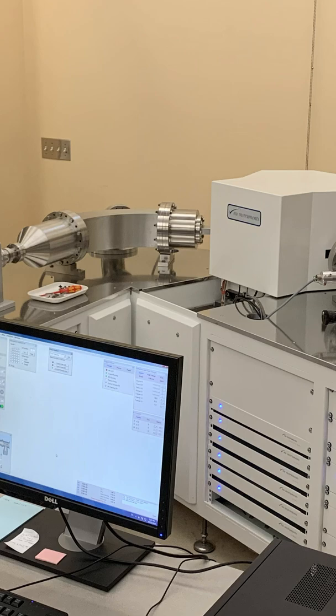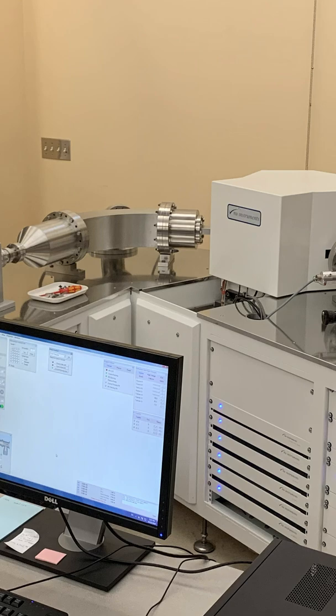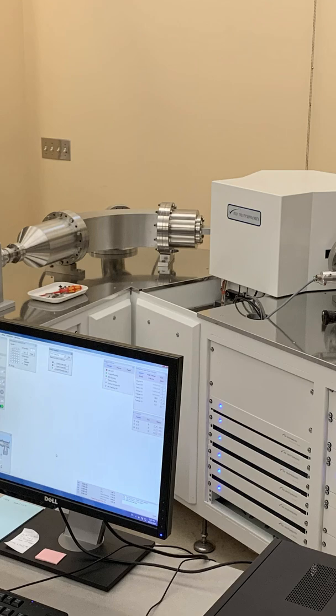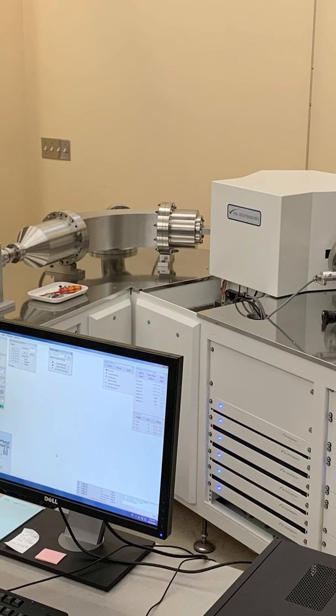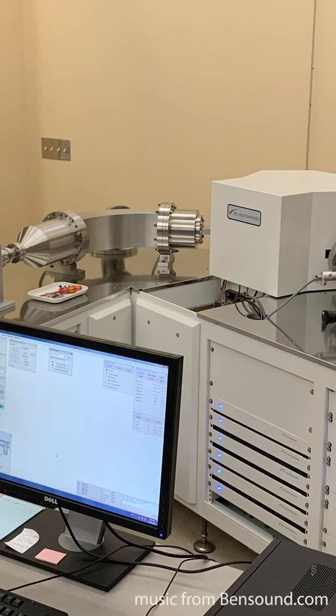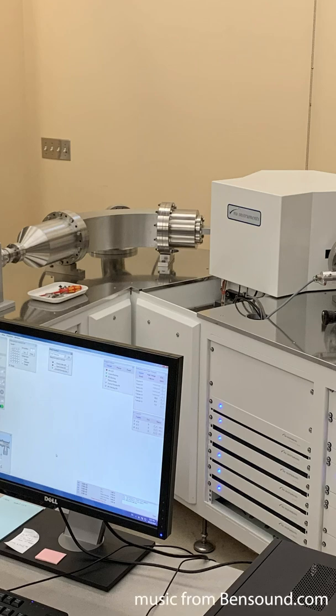Once we've purified our sample, we're ready to run it on what's called a mass spectrometer. The mass spectrometer allows us to measure individual elements down to parts per trillion levels — for every trillion atoms we pass through it, we only need one or two of the element we're interested in to be able to measure it. So we go from a really hard solid rock into a solution, into something purified sometimes to just a single element, and then we're able to accurately measure that down to the parts per trillion level. Geochemistry is incredibly powerful to tell us a lot more about the Earth as it is now, as it was in the past, and how we can expect life that may be in the future.